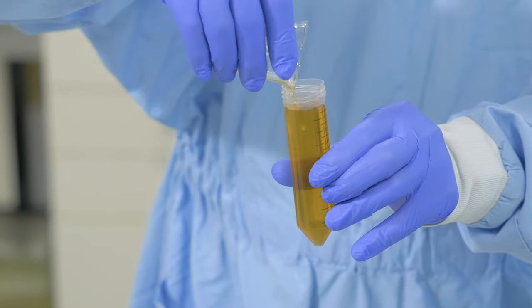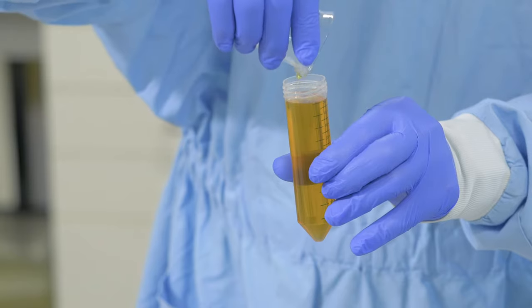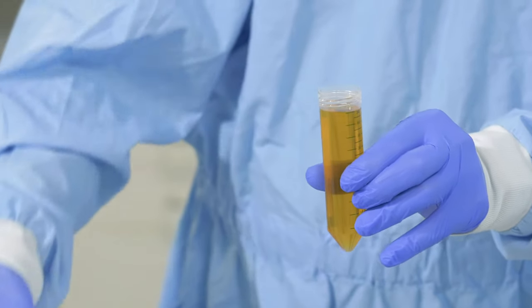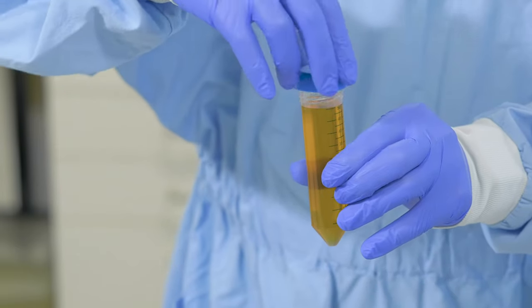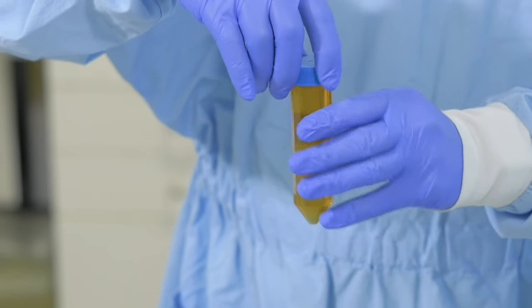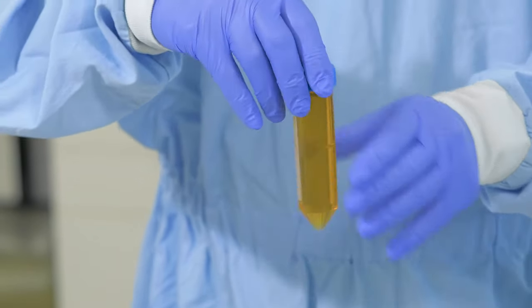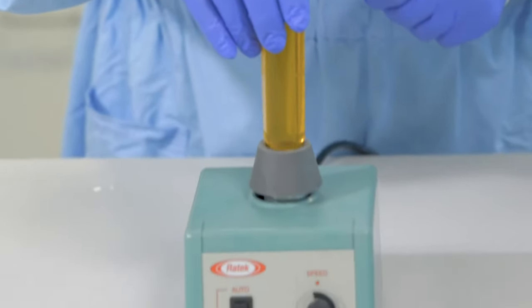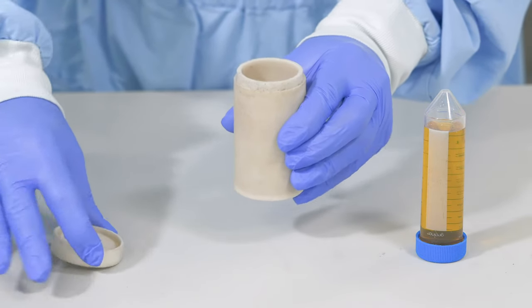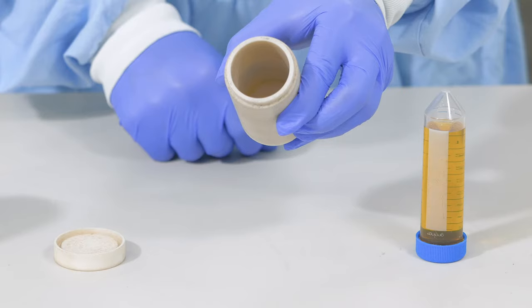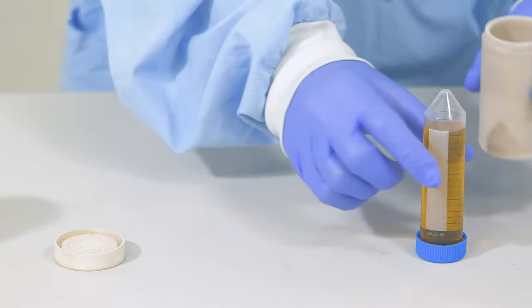In other words, we want a perfect degree of homogeneity or mixture quality which means ingredients appear in the same proportions in any sample taken at any point of the mixture. This will help us to have a more even reaction during the synthesis section. In this case, I use vortex to stir the solution more strongly. I will transfer the solution to a teflon flask and transfer it into the hydrothermal autoclave reactor.